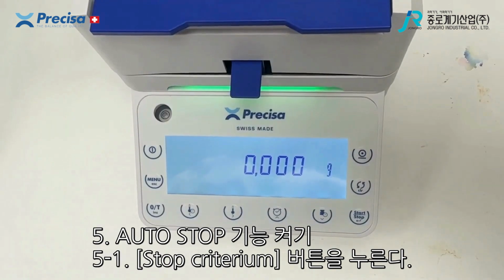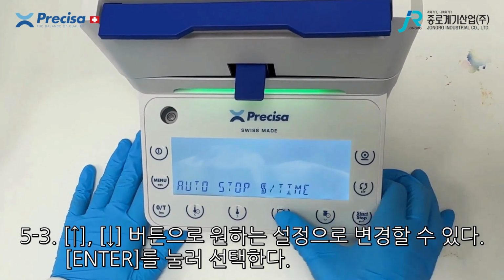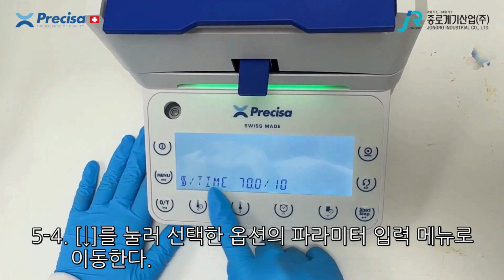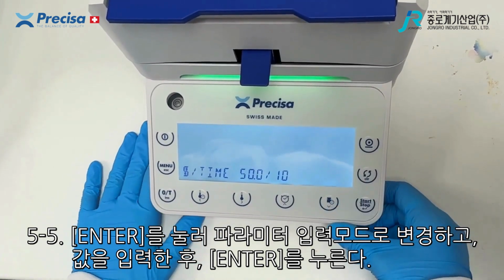To turn on auto stop, you're going to press this button here, then you can press start and scroll down until you find the one you require. Once you do, press start. Now you can scroll down and it takes you to the parameters. Press start, and you're able to change it into one that's right for you. Press start to lock it in.